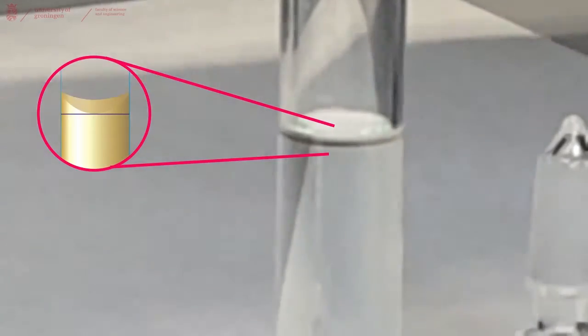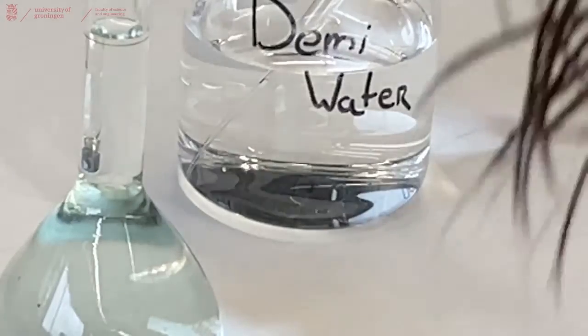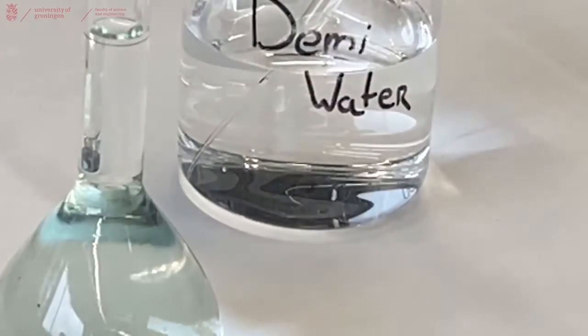It's a tiny bit more. And there we go. Perfectly with the bottom of the meniscus on the yellow line.